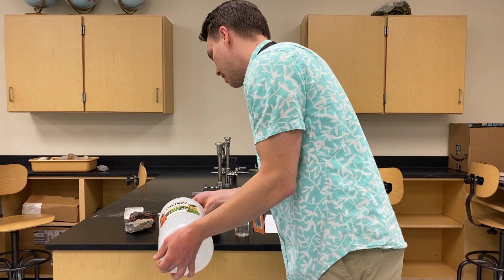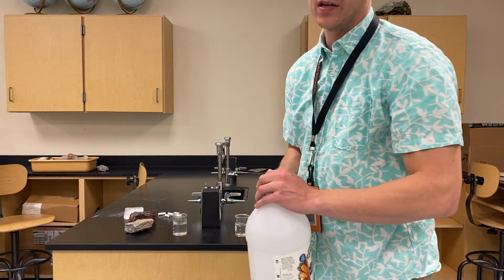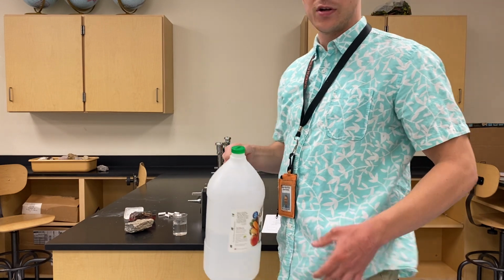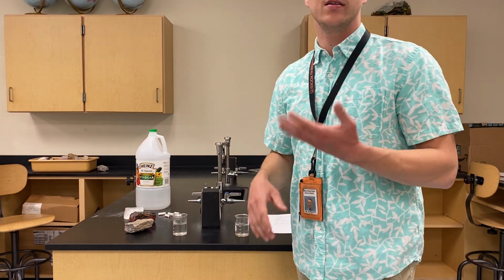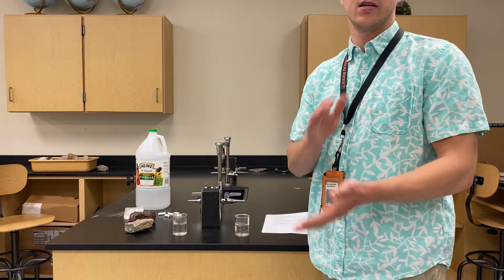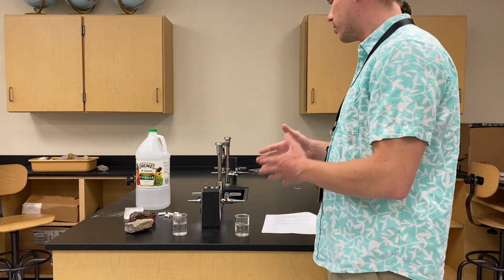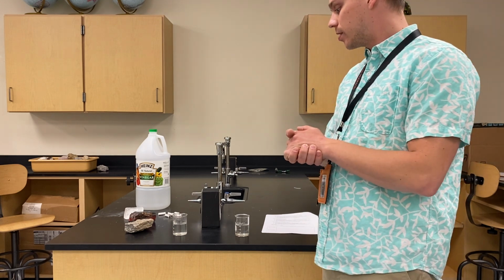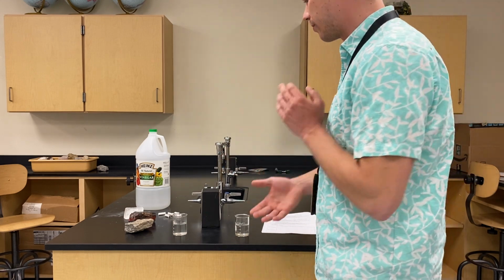Now vinegar is acid, but it's not necessarily like the acid that you would imagine or see in a movie. If you got it on your shirt and left it there for like a week without washing it, you may notice a color change. You may even notice on a certain material that it would burn through, but getting this on your hands is not really going to cause any issue. With that said, as this is a science experiment, you're definitely going to want to have access to water just in case you do get it on your skin, right? If you were doing this with a stronger acid or a more volatile acid, you'd want to wear protective eyewear.